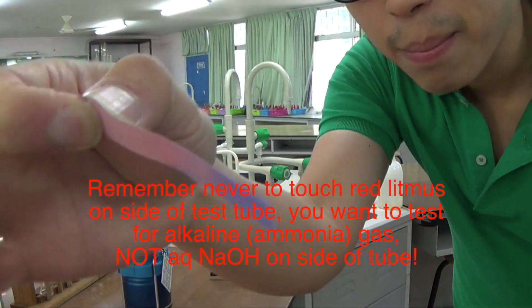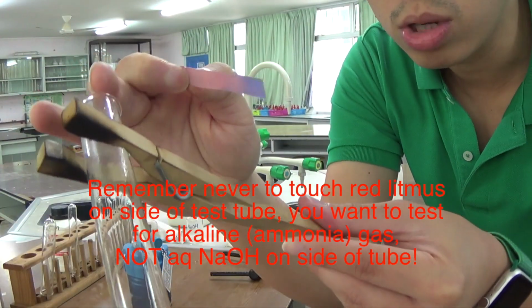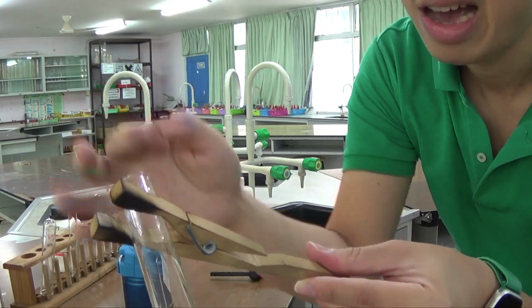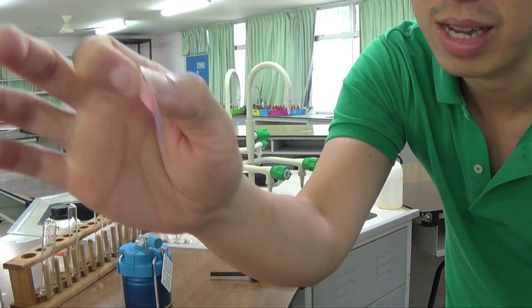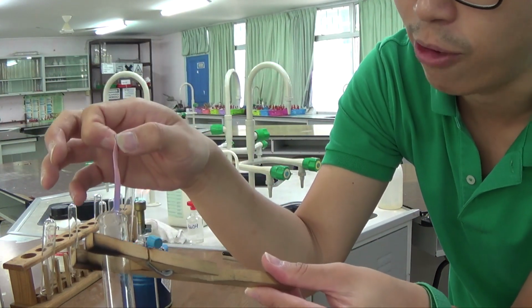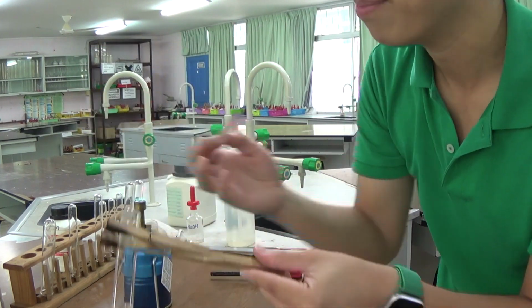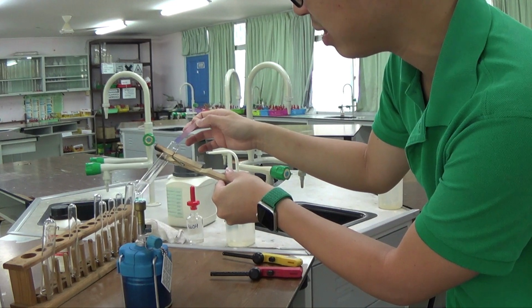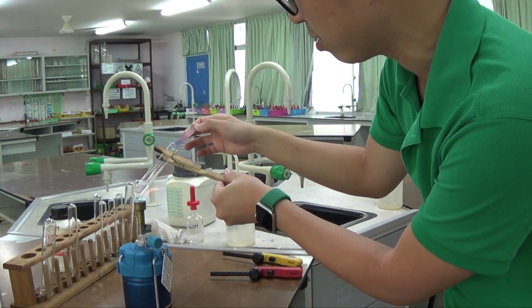So you could see my red litmus paper has turned blue. You do not want to touch the side because you have just added sodium hydroxide on the side. Of course, in the presence of sodium hydroxide, this will turn blue. So you want to capture the gas at the mouth of the test tube. You do not want to test for sodium hydroxide. That is my point. You want to test for the gas.